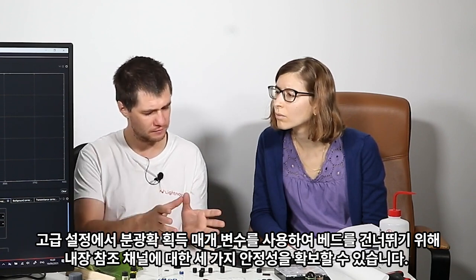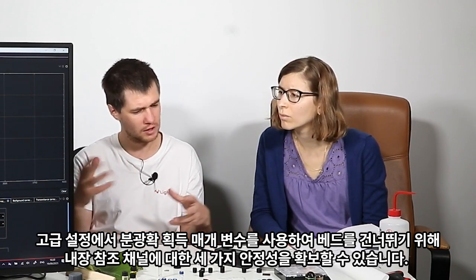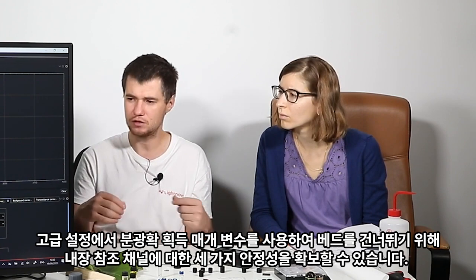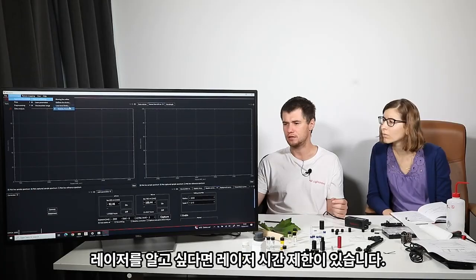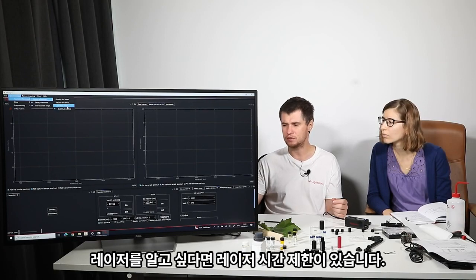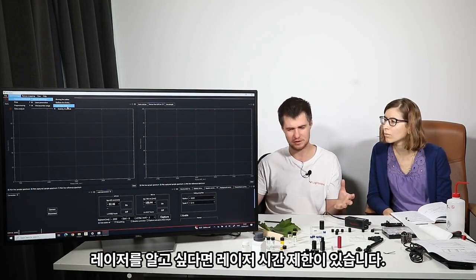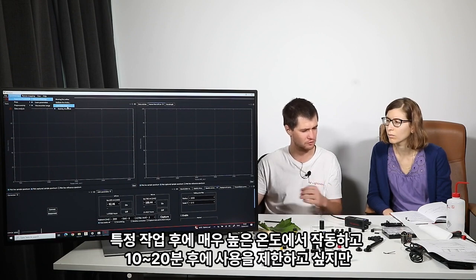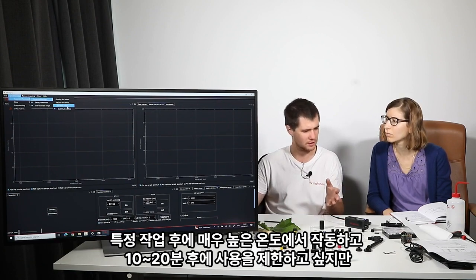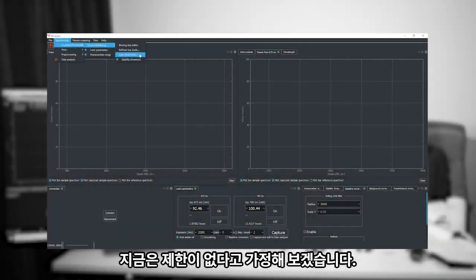It's for the inbuilt reference channel. In order to skip the bad spectra, you can optimize this threshold. We can try it later. Then laser time limits, if you want to turn off the laser after certain operation. Let's say you operated at very hot temperature and you want to restrict using it after 10-20 minutes. But we have no limits right now.